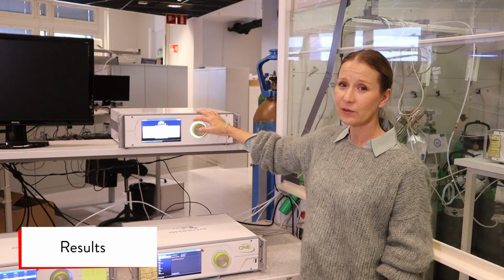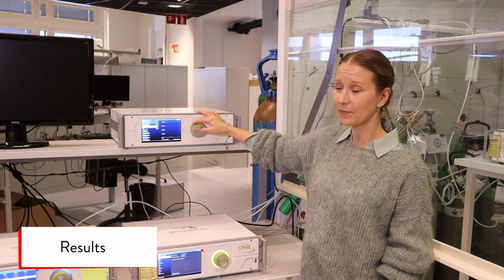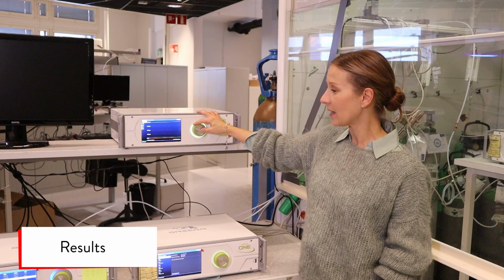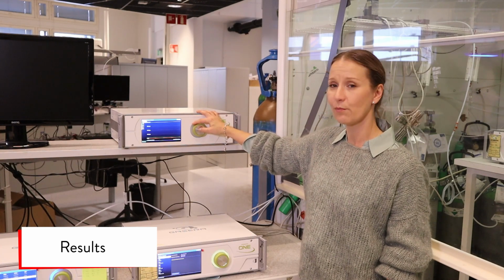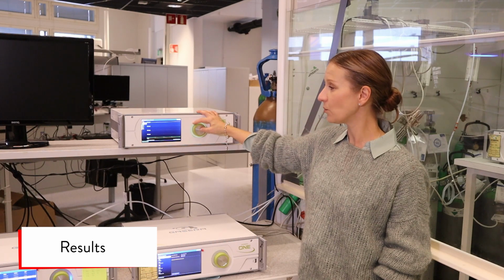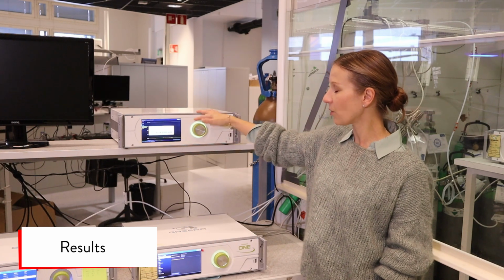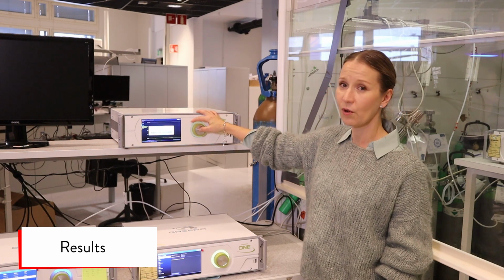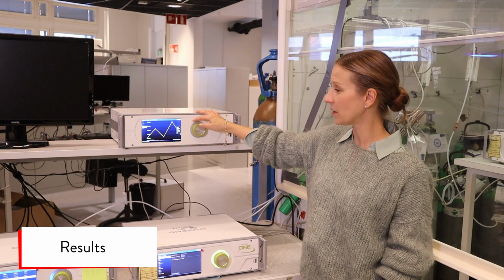From the results menu you can check the measurement, and we just selected the measurement ABC, and it's showing us the same view as in the measurement. You have all the components and you can choose one of them by selecting the rotating button and show only, and you get the same view as during the measurement.